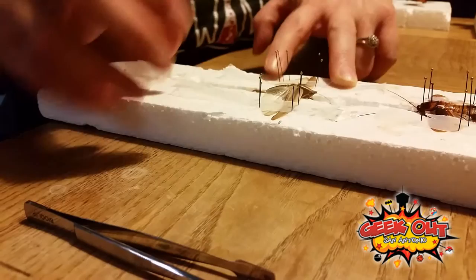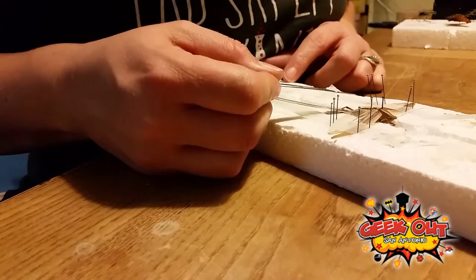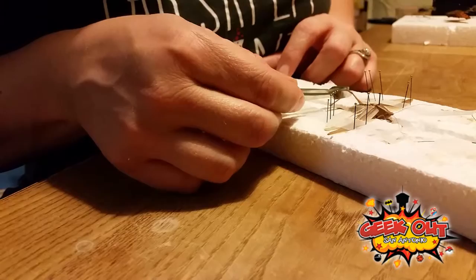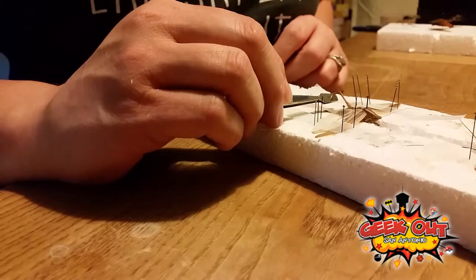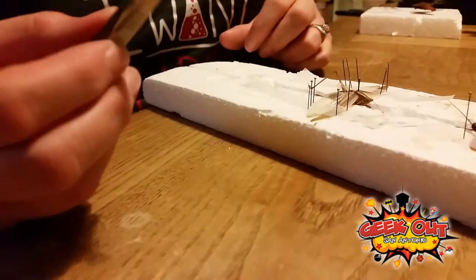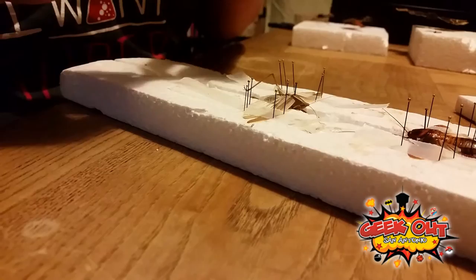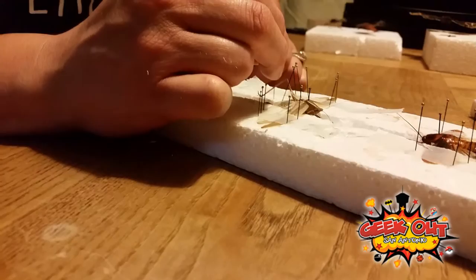I still am not super fond of them when they're alive. So tell me how to pin the legs — like if somebody was just following these steps. You want to pick his leg up. It all just depends on your personal preference. I'd like mine to look like he's jumping — hopping. So you want to pick him up on top of the styrofoam, it just depends on what kind of effect you're trying to get. For the legs, you basically just want to put one pin on either side, maybe one pin to keep it flat to the ground. The highest number of pins I've used for one insect is somewhere around 34 or 35 — I use lots and lots of pins. I like for it to look very nice, very professional.